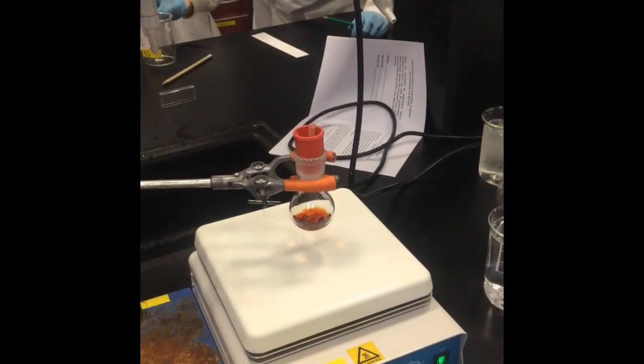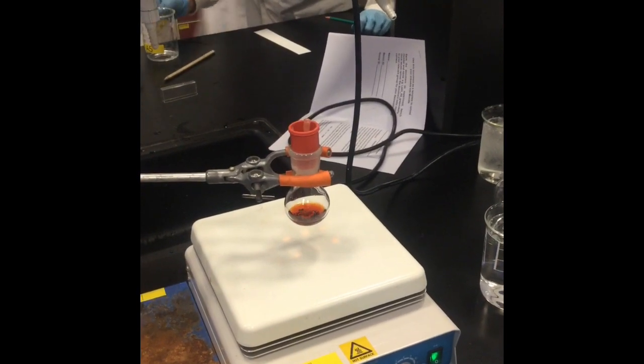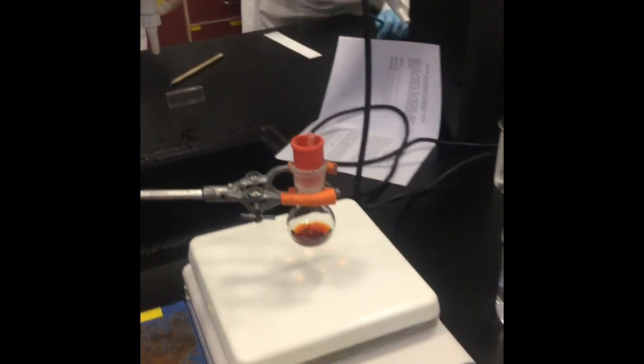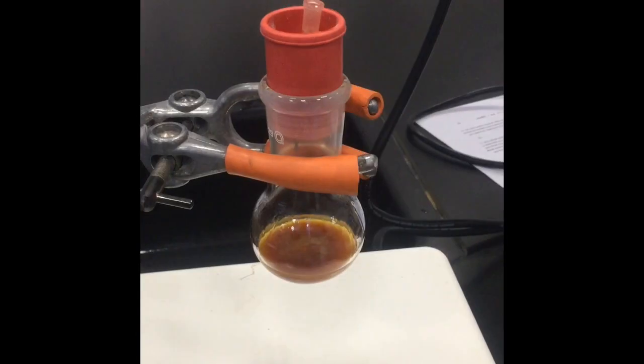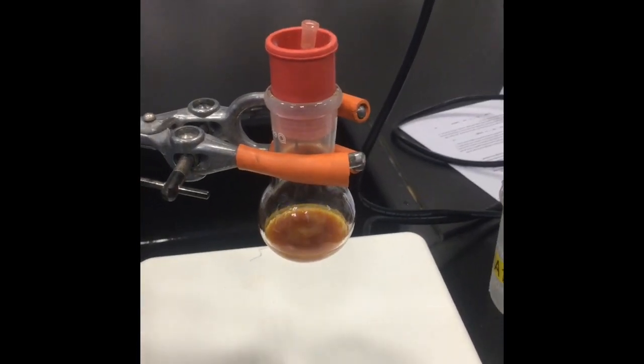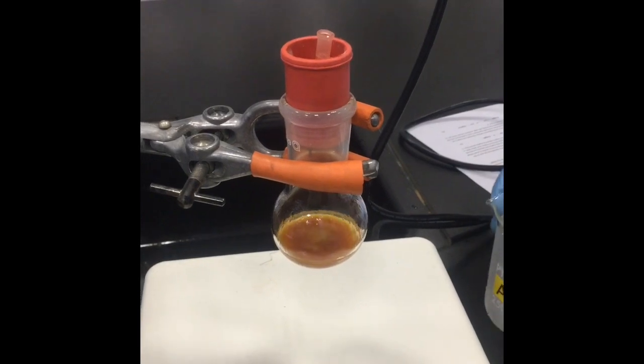Note the color change of the reaction. The reaction can take up to 5 minutes to start and it is important to observe the reaction while it is taking place. You will feel the flask get warm once the reaction has started.